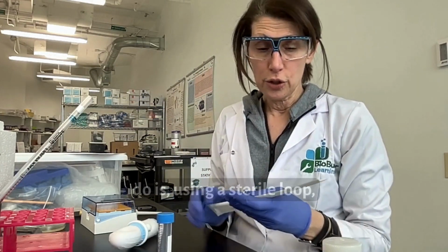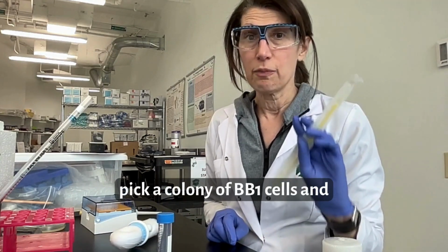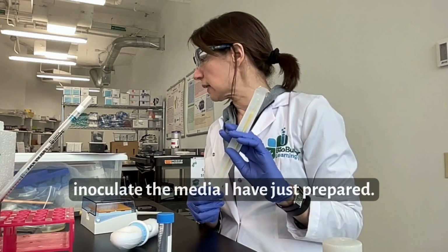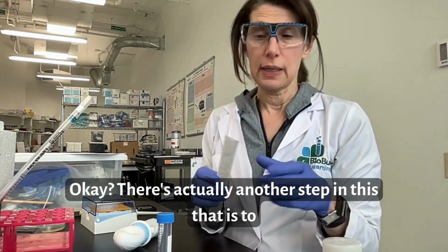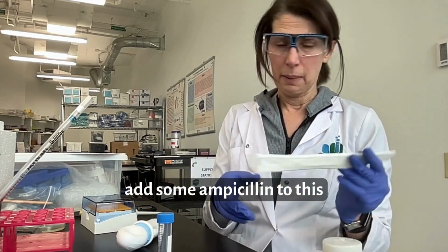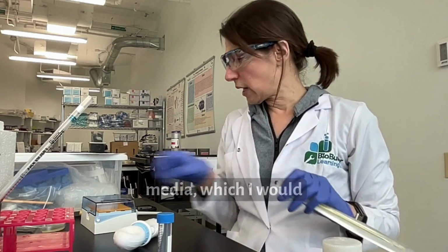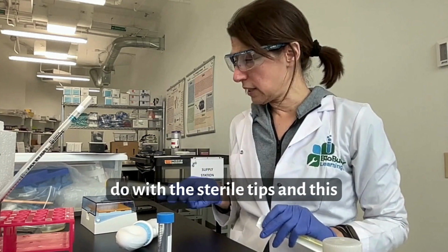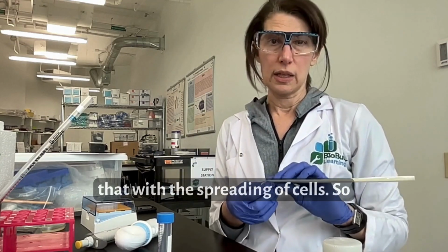The next thing I'm going to do is, using a sterile loop, pick a colony of BB1 cells and inoculate the media I have just prepared. Okay. There's actually another step in this that is to add some ampicillin to this media, which I would do with the sterile tips and this P20, but I've shown you how to do that with the spreading of the cells.